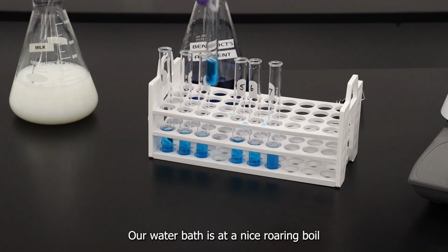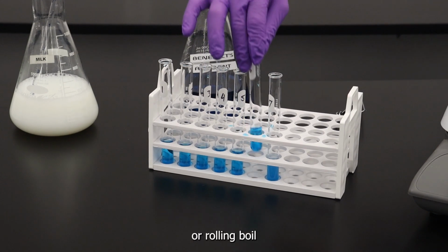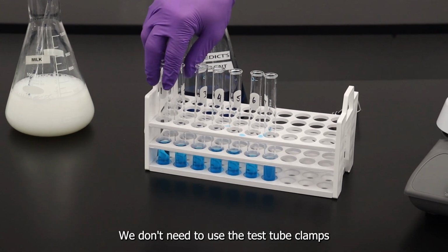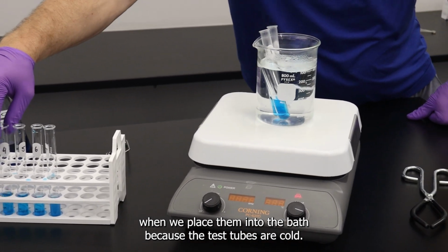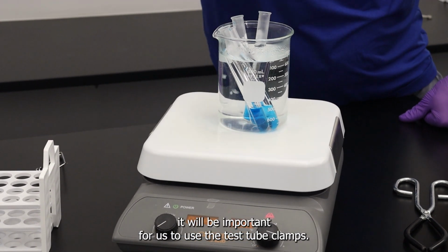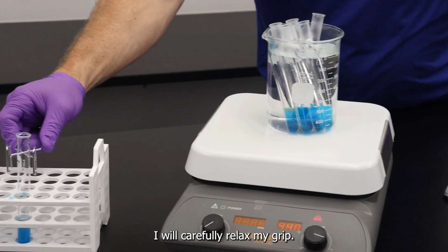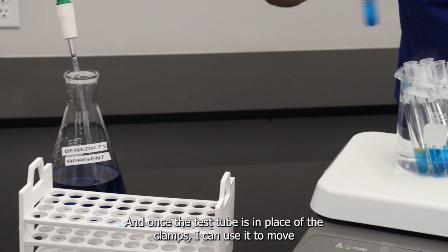Our water bath is at a nice roaring boil or rolling boil, and we can put our test tubes into the bath. We don't need to use the test tube clamps when we place them into the bath, because the test tubes are cold. When we go to remove the test tubes, it will be important for us to use the test tube clamps. What I'll do is I'll depress the sides to open the clamps. I will carefully relax my grip, and once the test tube is in place with the clamps, I can use it to move.